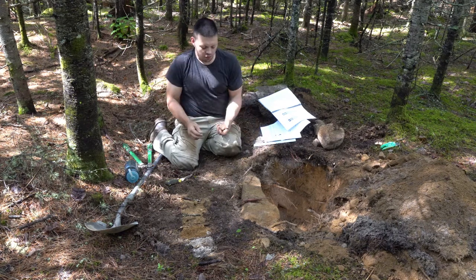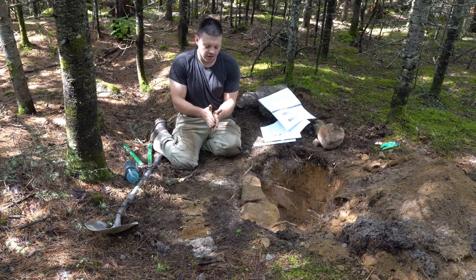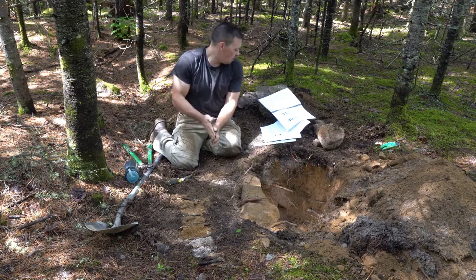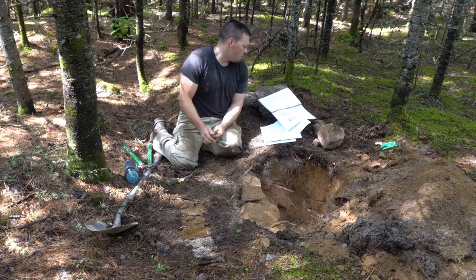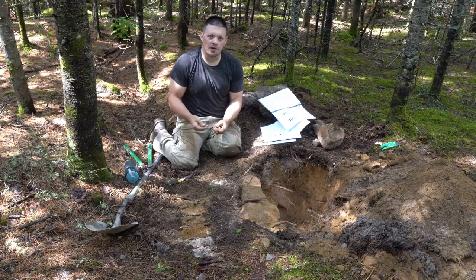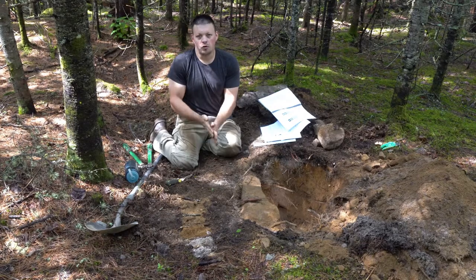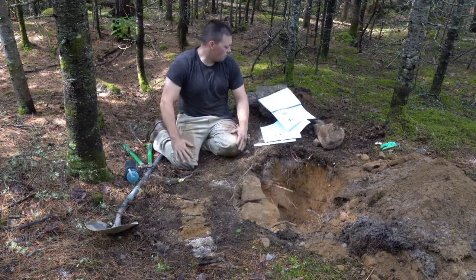Next, we simply roll it between our thumb and our hands to try to make a ribbon. And we see as it comes out of our hand, does it fall apart or does it form a ribbon? And we see it falls apart into pretty much nothing as we try to form a ribbon. So based on the cast, I would say it has a weak cast. In terms of ribbon, it flakes. So it doesn't form a ribbon at all, it just flakes. Based on that, we're dealing with a silt loam soil texture. So our BF horizon, we would give it a silt loam.